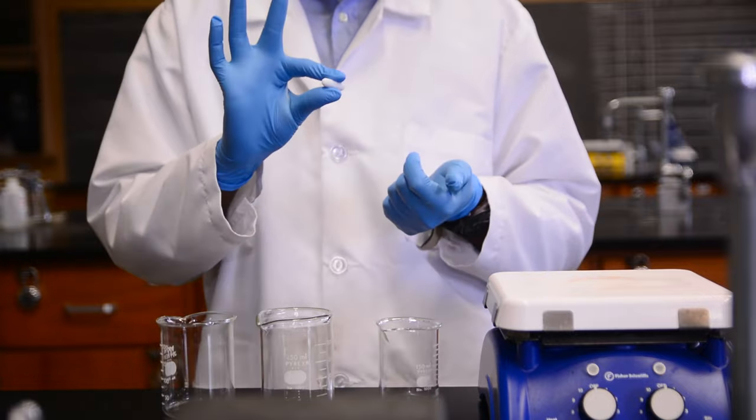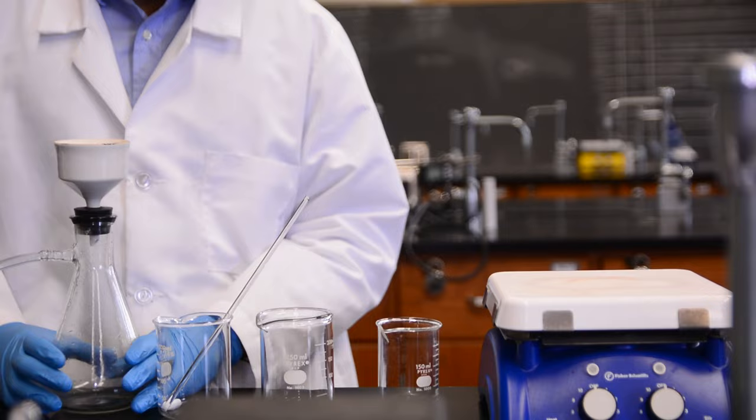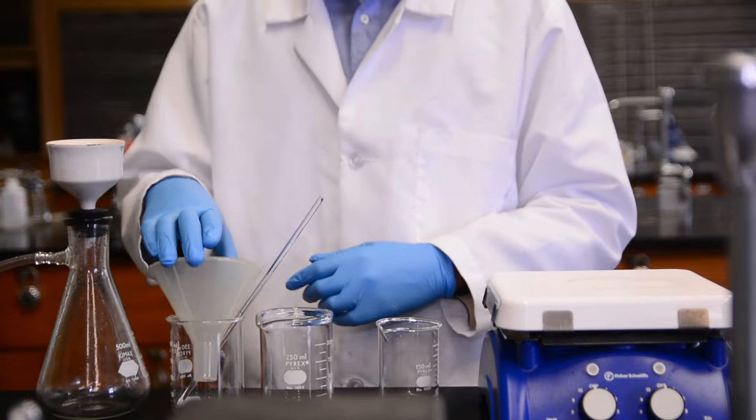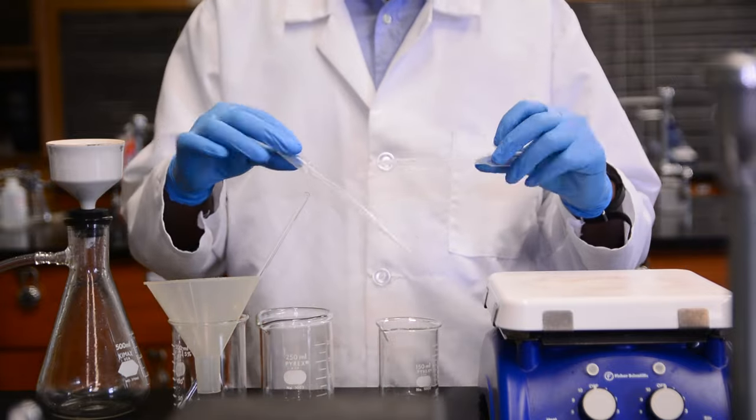We will also need a stir bar, stirring rod, a vacuum filtration setup, a powder funnel, a watch glass, and disposable pipettes.